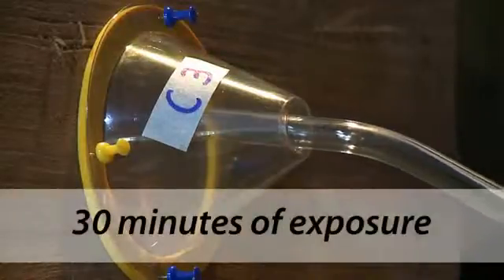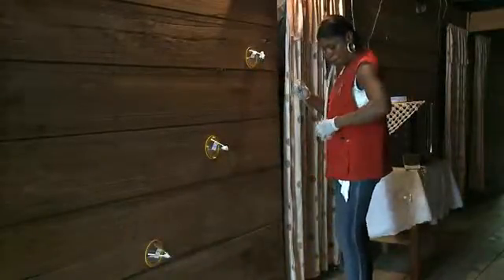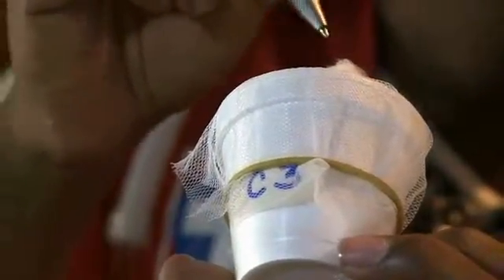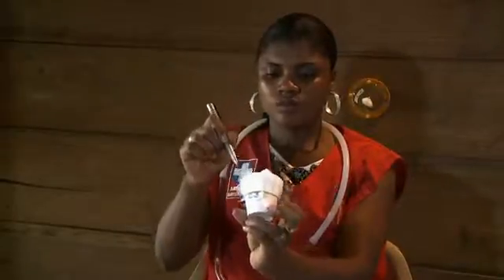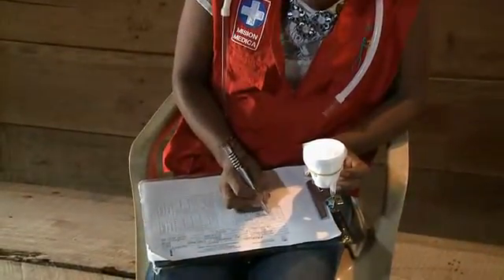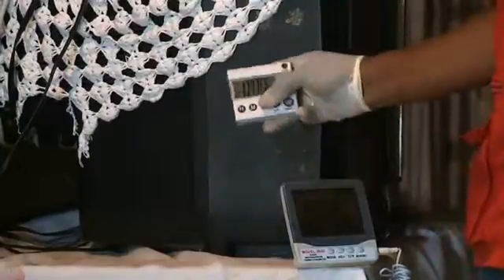After 30 minutes, carefully take out the mosquitoes from the cones and transfer them to separate labeled cups. Count the number of mosquitoes dead or knocked down at the end of the exposure period, but do not remove mosquitoes that appear dead, as some of them might later recover. Take note of the temperature and humidity and record them in the data collection form.